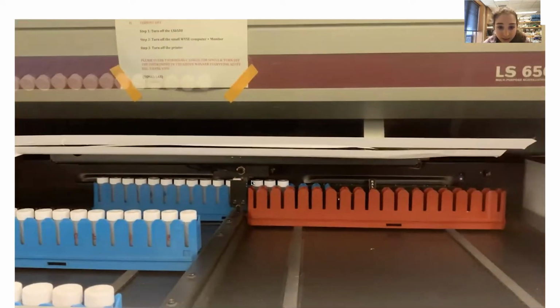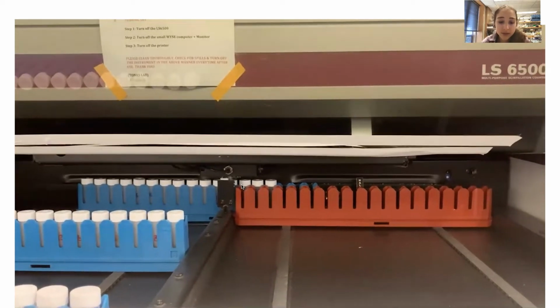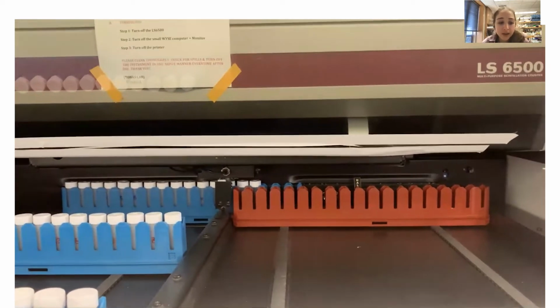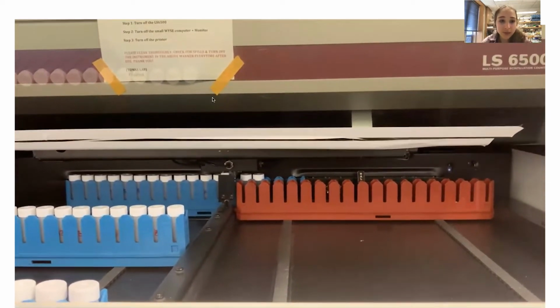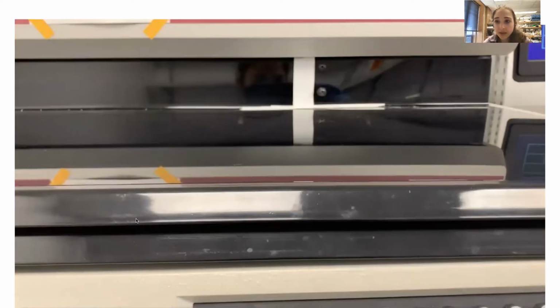So if we watch that again, you can see here it's going to put back the sample that it did before. Then it moves over, and then it takes the next one. So it's really, really cool. So it's taking it into this chamber where it doesn't have to worry about picking up the radioactivity from the other samples.